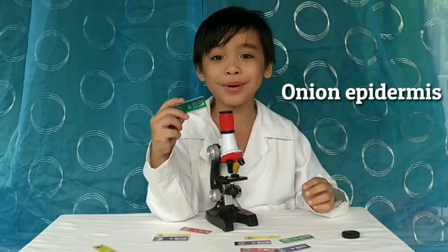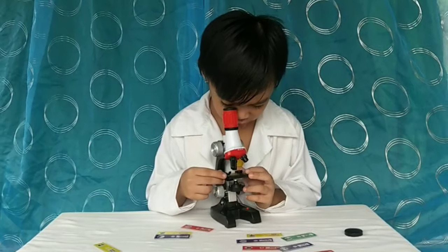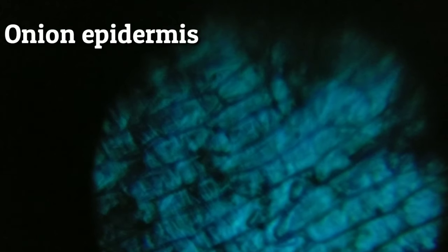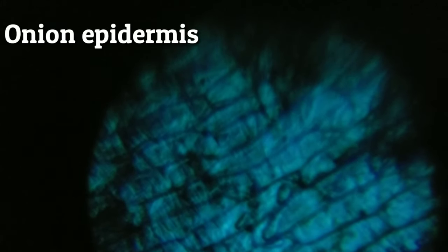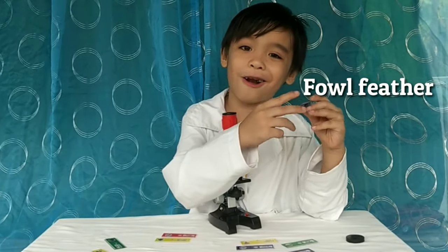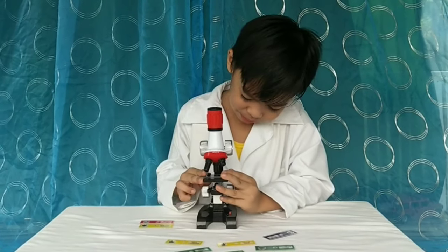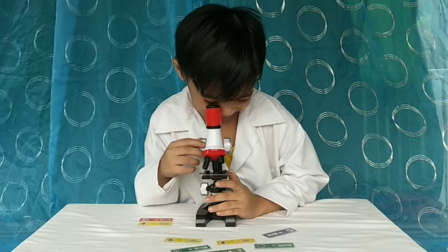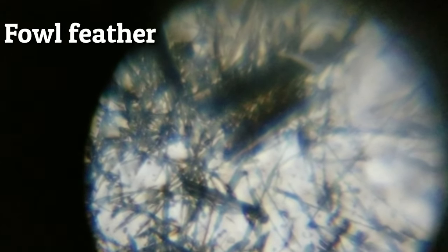Onion epidermis! Look at the cells! Wow, so amazing! Many lines — so messy!